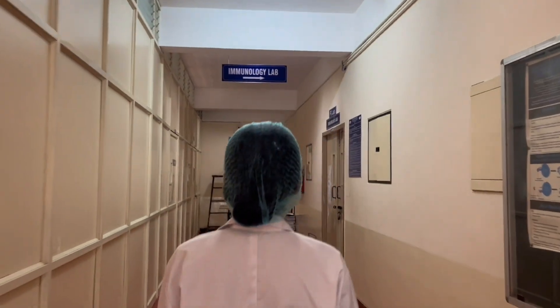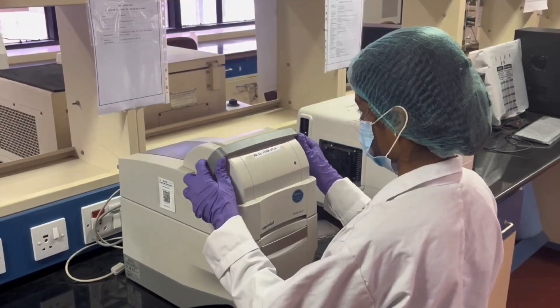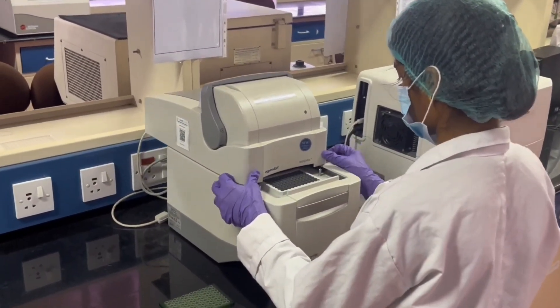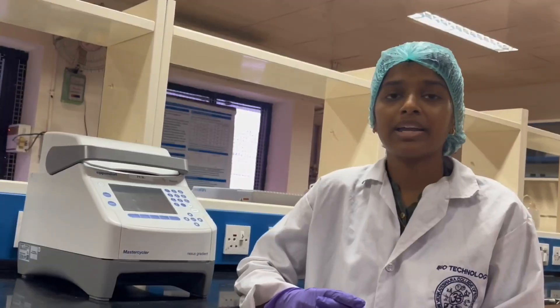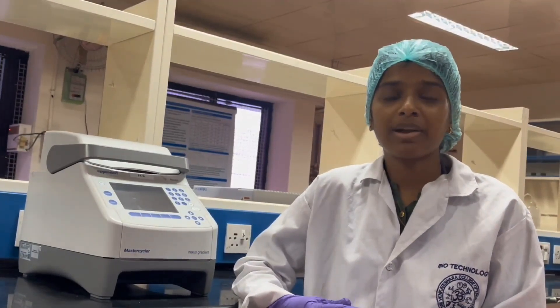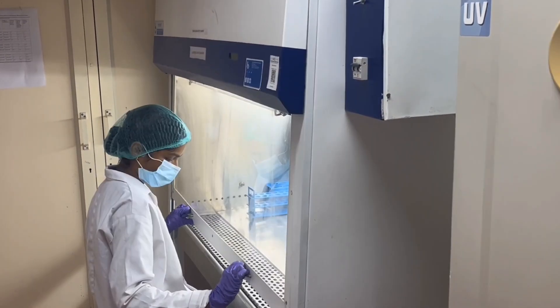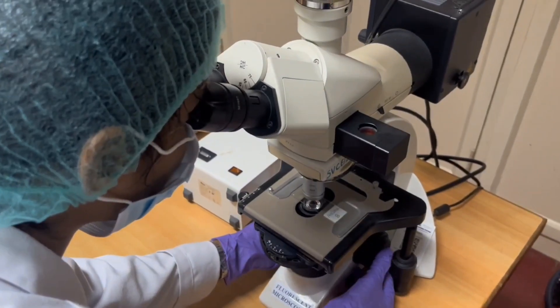I am Varshini Kaya, from final year. My field of interest is Immunology and I am currently doing my project in Cardiovascular Disease. To study the pathophysiological pathway, gene expression can be delineated using RT-PCR, and protein expression can be studied using a semi-quantitative method by Western Blotting and a quantitative method by ELISA. Gene manipulation techniques like gene silencing and overexpression can also be performed, and cells can be visualized using fluorescence microscopy.